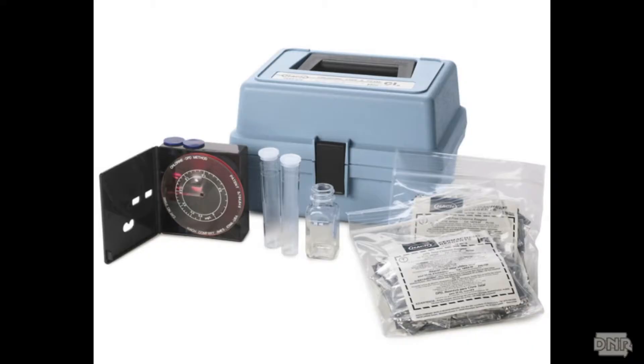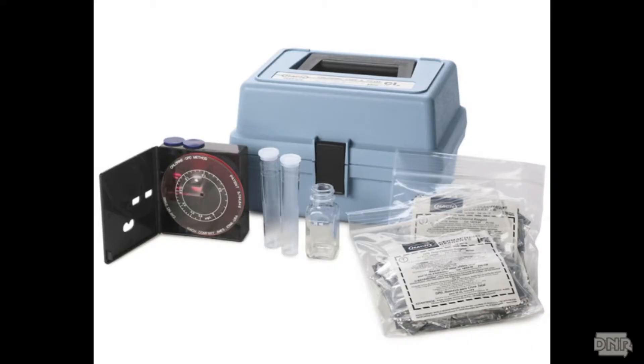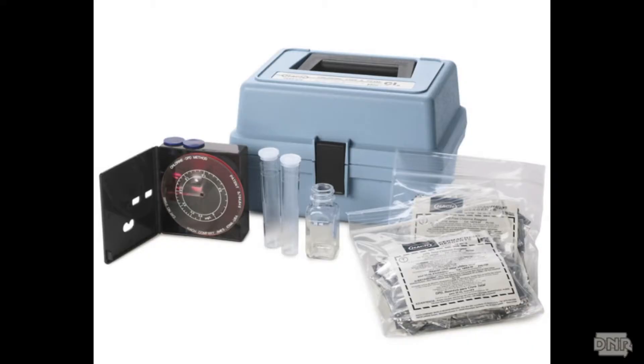Chlorine residuals are typically measured with a test kit and must be measured immediately. Portable or bench top colorimeters are strongly recommended. Color wheels are strongly discouraged as they depend so much on personal interpretation of the color. It is very important that the sample used for chlorine measurements be representative of the water to be measured.